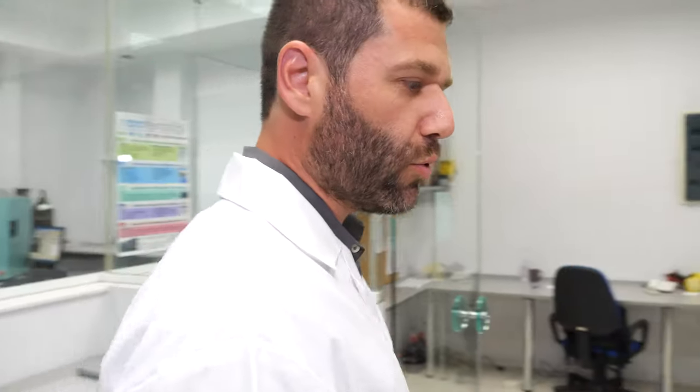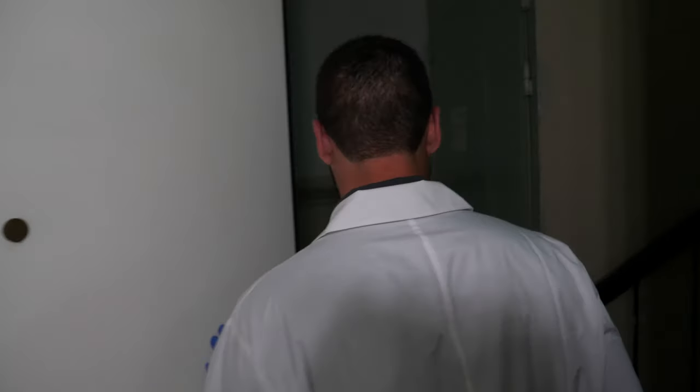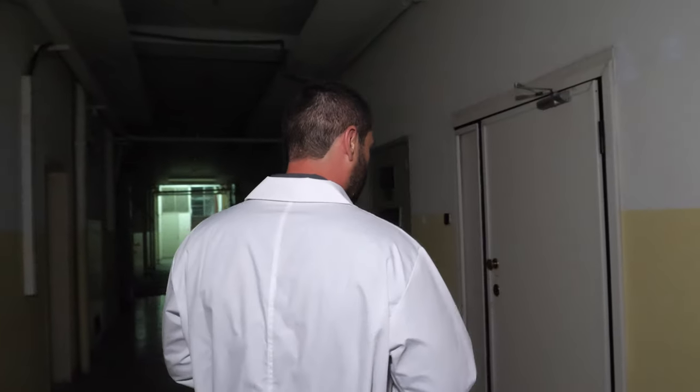What is your background? I am a biologist. My PhD is in a mechanical engineering department, on biomechanics. From my PhD I saw that we have to combine many disciplines to achieve greater things — studying a static cell culture is not enough, you have to go dynamic. We are trying to combine some living computers — something like that.